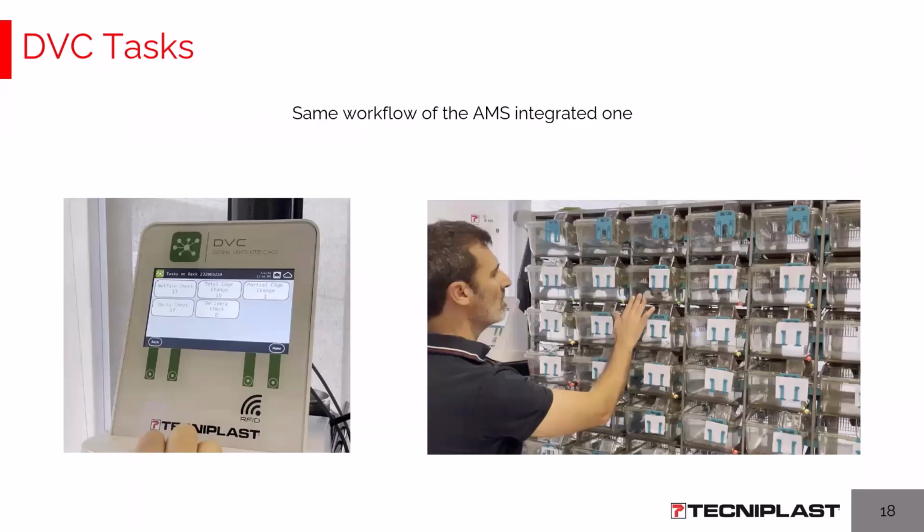Proceeding with the cage life workflow, touching the DVC tasks, in this case, at least from our perspective, the preferred approach is still the same through the DVC master interface. Theoretically, in this case, you can also have the DVC Operator interface running in your laptop or tablet to support you performing this task, but we assume that the preferred approach would be through the DVC master interface, because in any case, the tasks should be performed just in front of the rack. We strongly believe this is the best way.